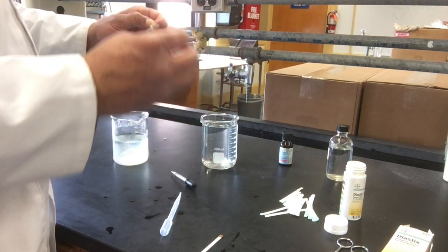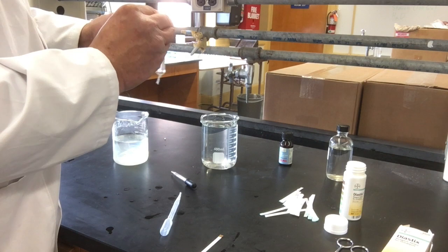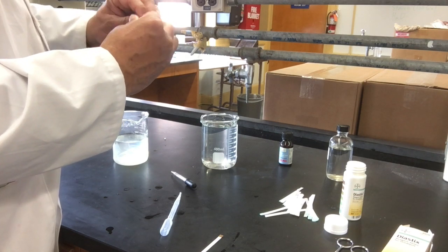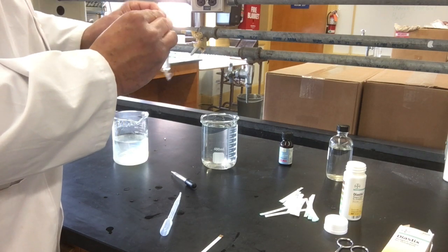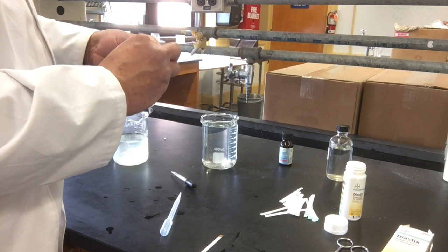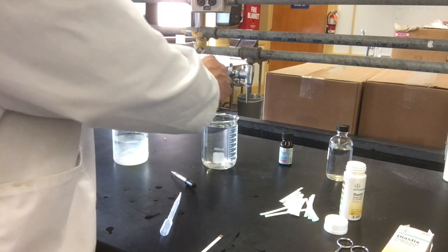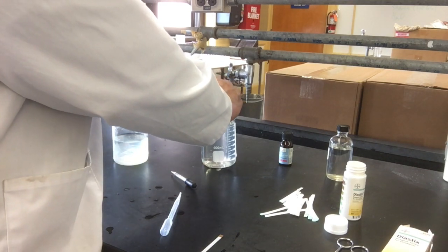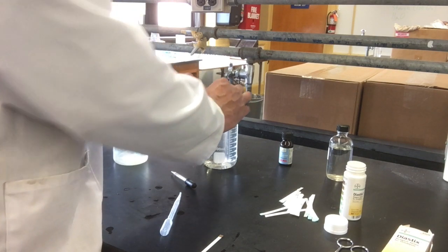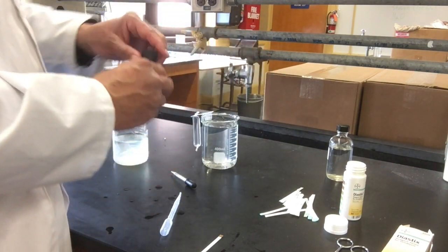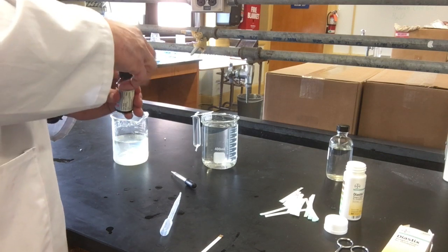I'll attach the dialysis bag to a clip. The clip allows me to immerse the bag into the water without touching anything else. I'll set it aside for now while I add iodine to the beaker.